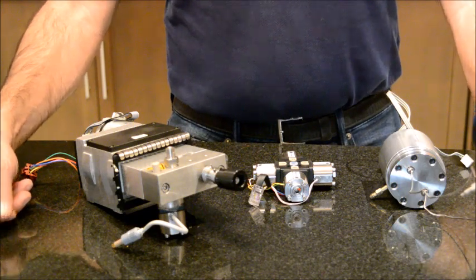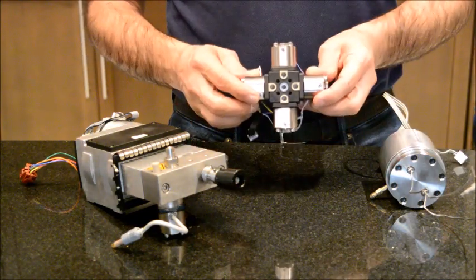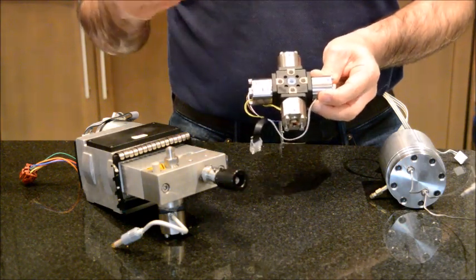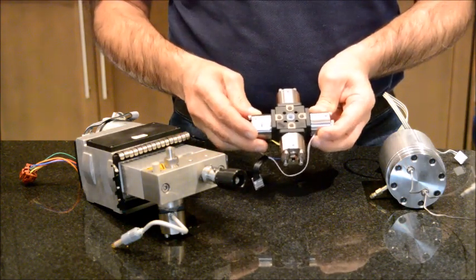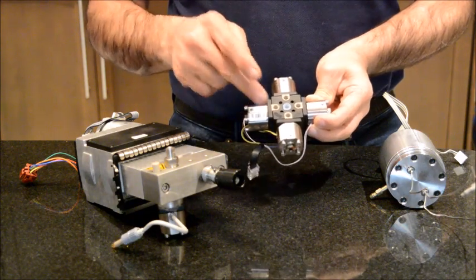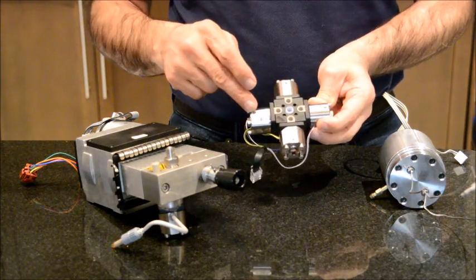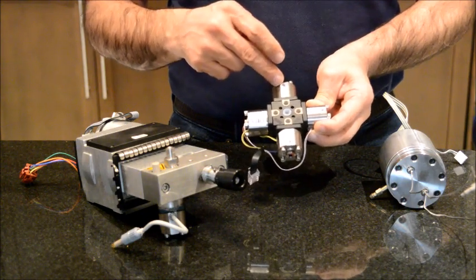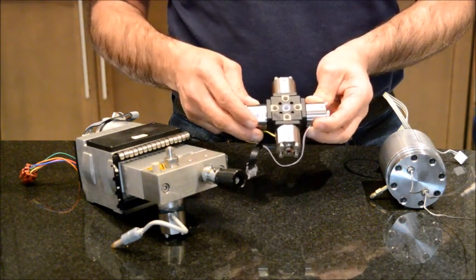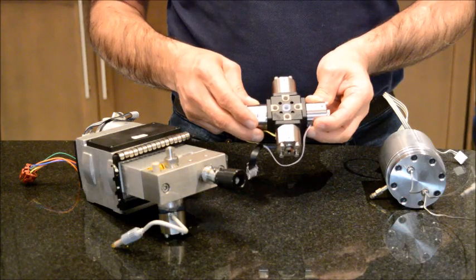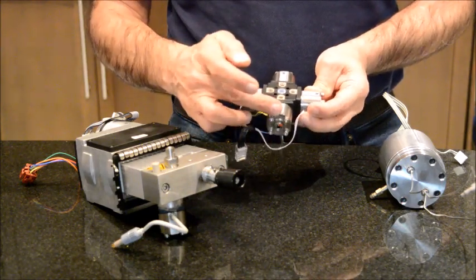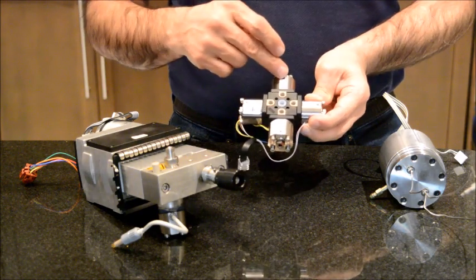Now let me talk about the gradient proportion valve and the problem that you may face related to this component. The gradient proportion valve has four solenoid valves, and they will open and close based on the program that you have in your acquisition method. Let's say you ask the system to give you 50 percent A, 50 percent B, and zero of the other two mobile phases.